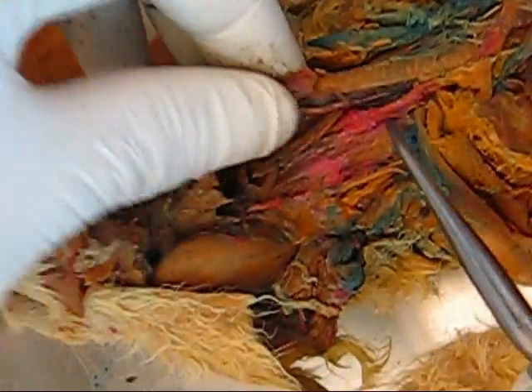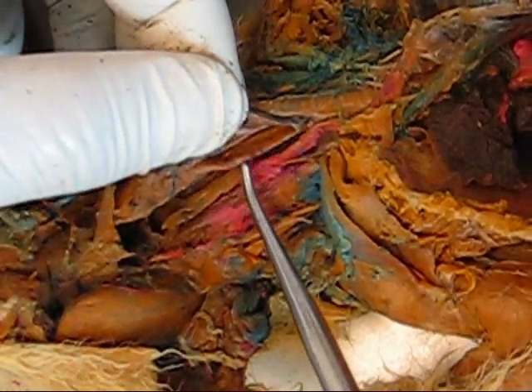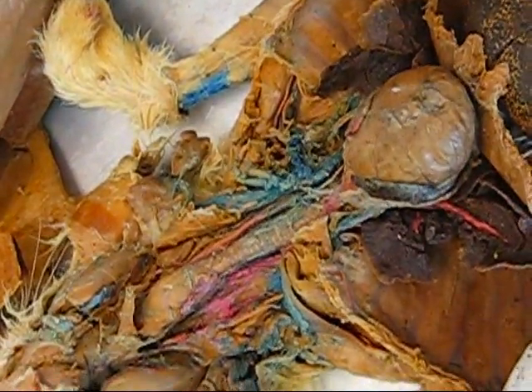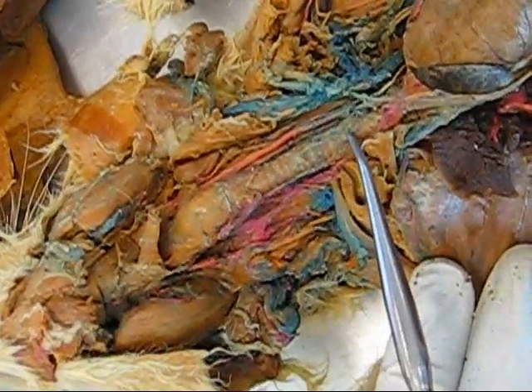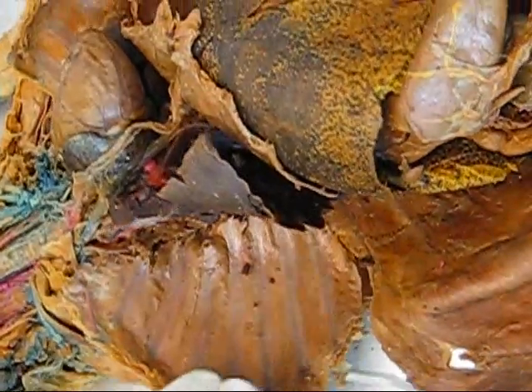Esophagus is here behind the trachea — this flat tube here. Thymus — the glandular tissue that's superior and anterior to the heart — it's been removed from this rabbit. Diaphragm is this muscle here. Trachea is this structure here. Visceral pleura — an indesectable membrane covering the lungs.